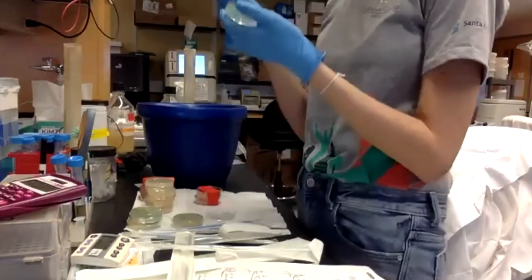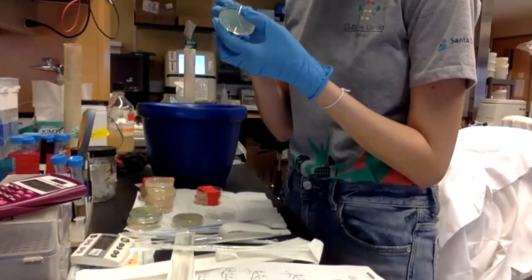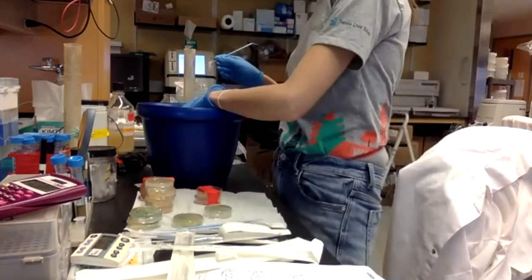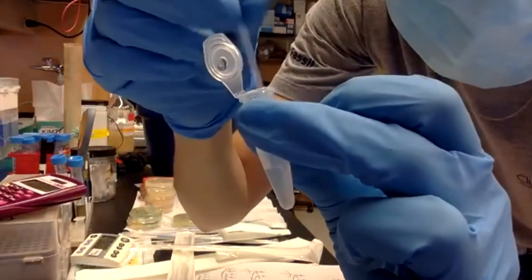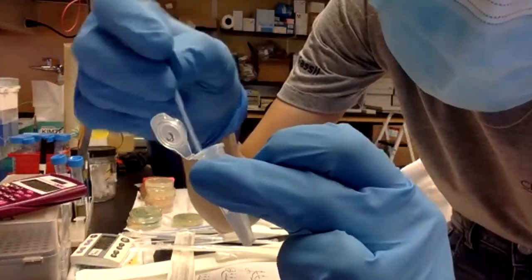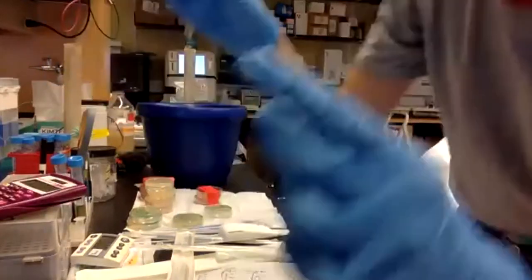Now I will take it from the arabinose. Our colony, C and D. Okay.